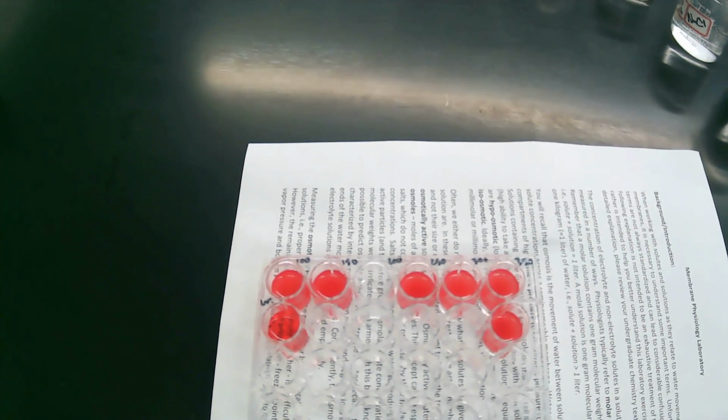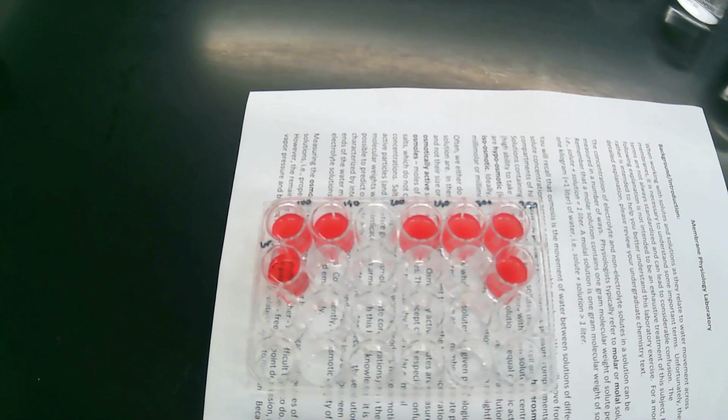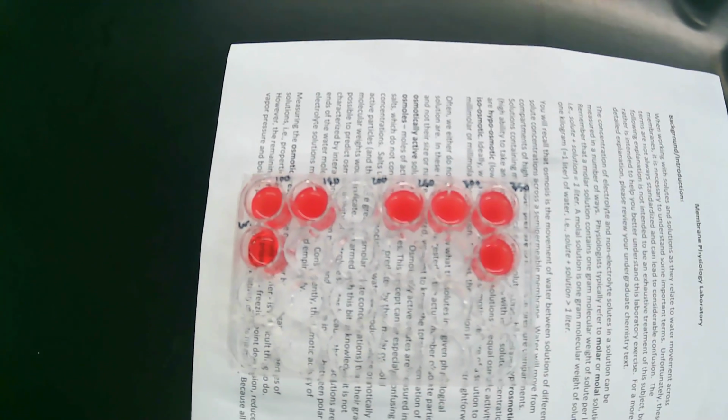Okay, so we've had our solutions sitting here for the last 15 to 20 minutes, and there are a couple of things that I'm going to point out that aren't going to be as obvious to you because of the quality of the video. But in general, if you look at the DI water, of course, you can see the type through that. At 100 milliosmoles in that solution, blood also begins to clear, but it still remains somewhat opaque. I can see the letters, but I can't read the words through the 100 milliosmol solution.